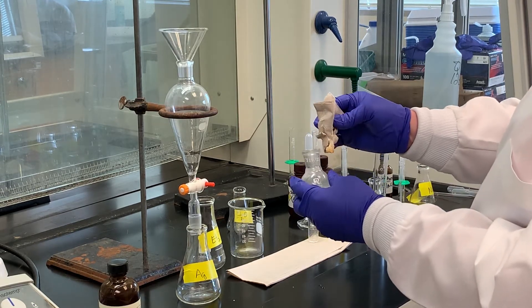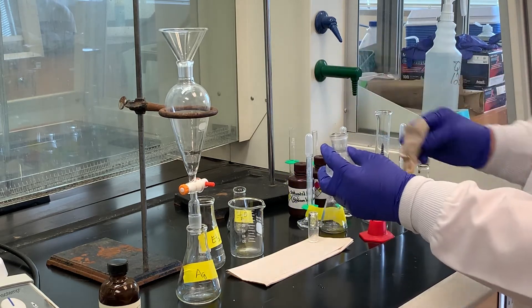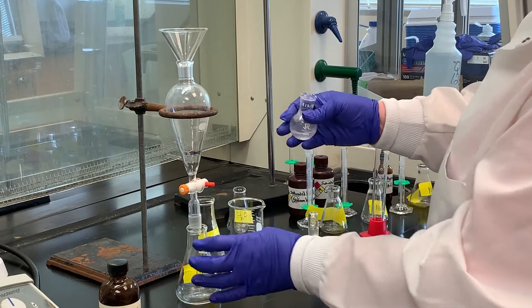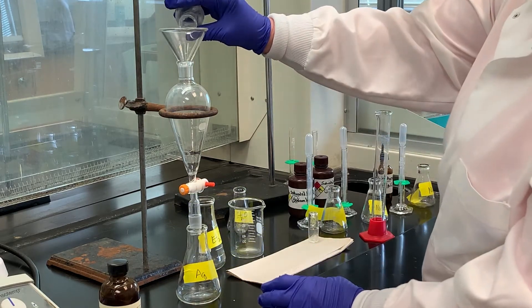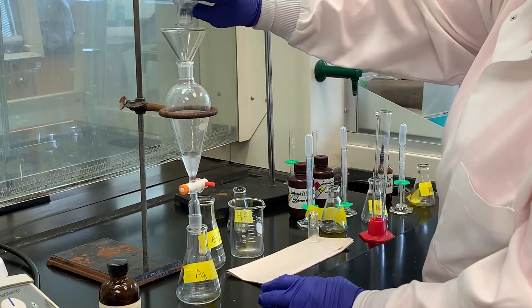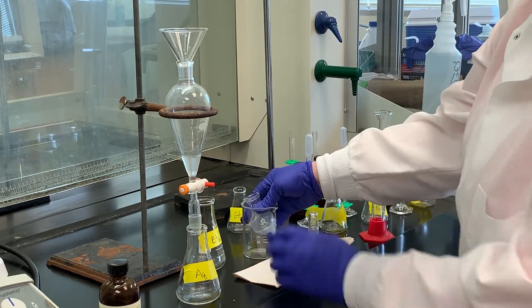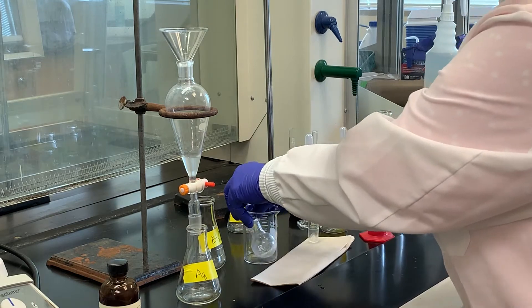So what we're going to do, this is cool to room temp. I've wiped out all the grease inside the joint. Stopcock is closed. I'm going to add that to the separatory funnel, and it may be very difficult to see, but there is a very small layer.